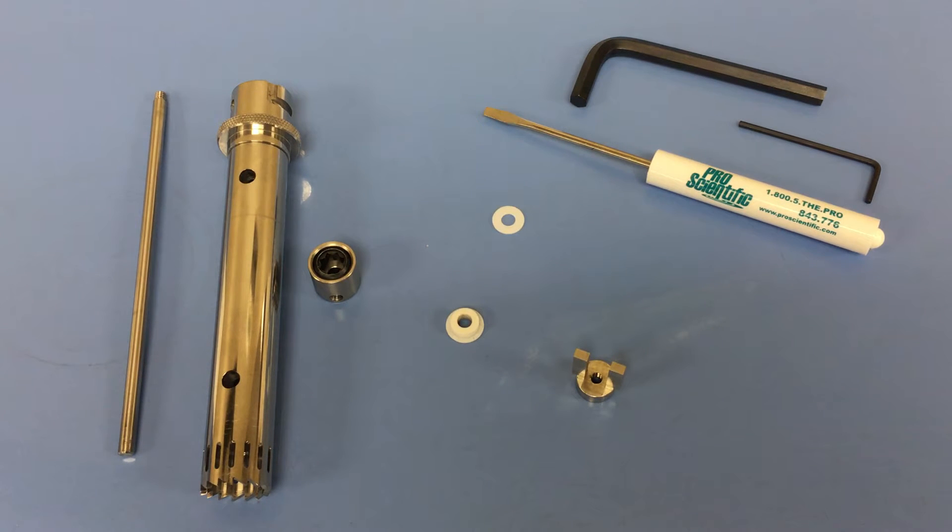Assembling a 7mm, 10mm, 20mm, and 30mm generator probe.